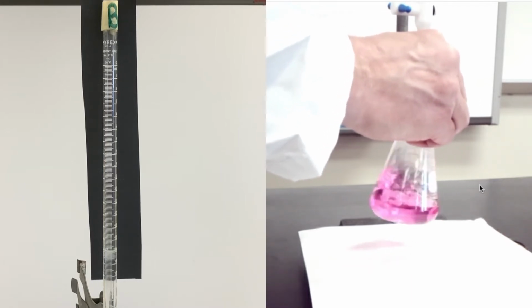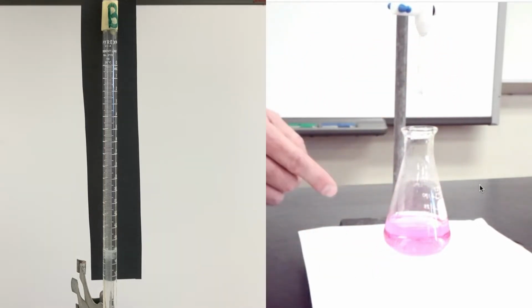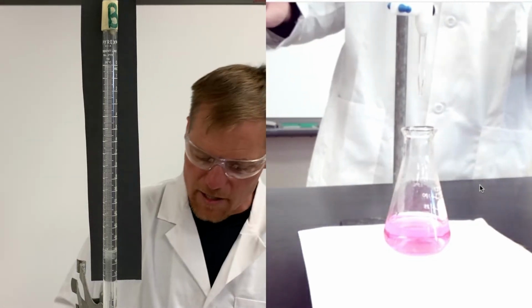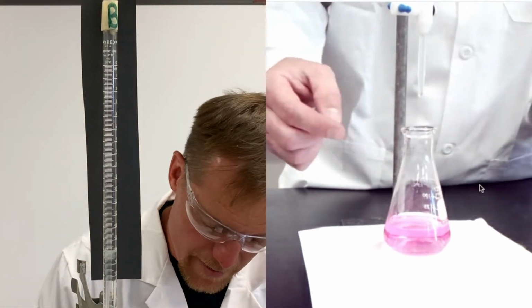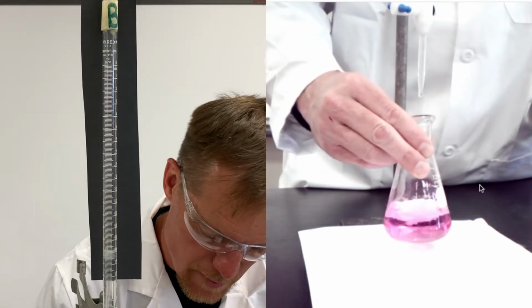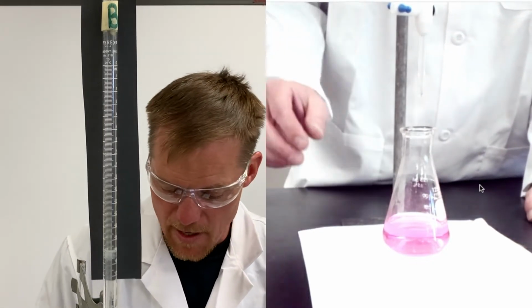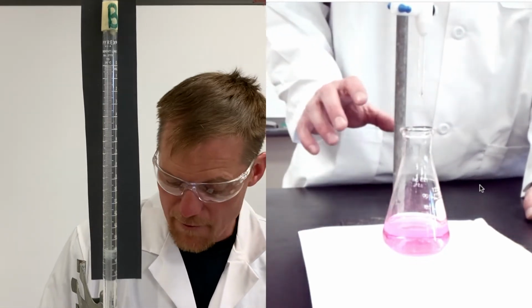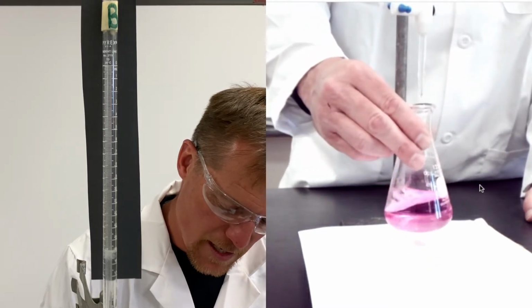Now, I'm gonna be honest with you. If you keep mixing really, really hard, you can sometimes get this color to disappear. And that's because if you're splashing around just the room air in the water, that carbon dioxide actually will mix with the water and make carbonic acid. It will make it a little bit more acidic. You don't need to do that, all right? If you swirl it for about 5 seconds and you see that there is a continuous light pink color, you've reached your endpoint, okay?